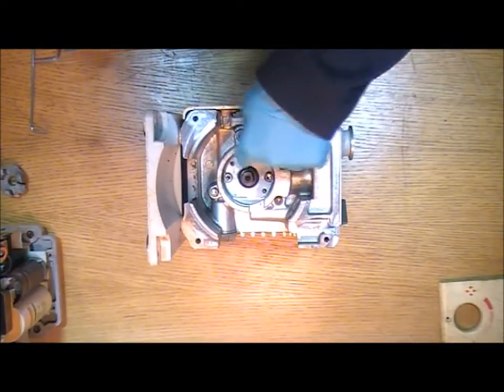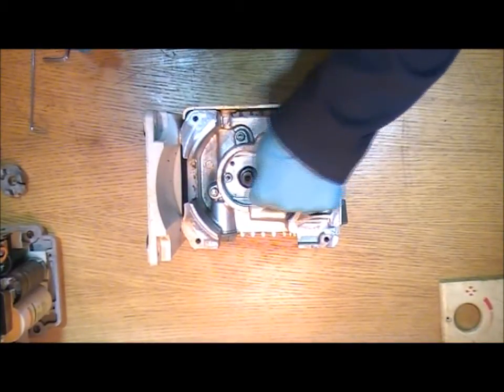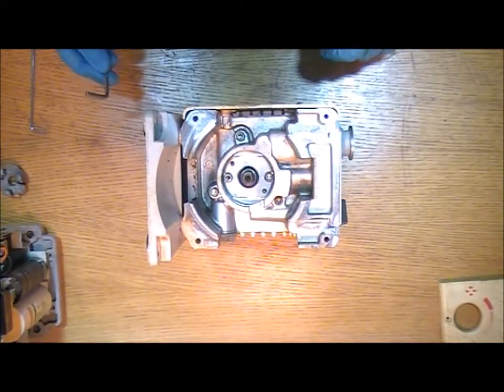And now you've reached the seal carrier and this is the part that we're actually going to be looking to replace.